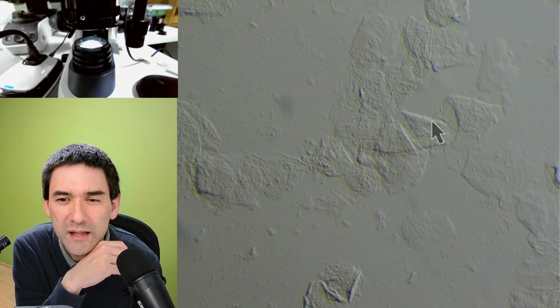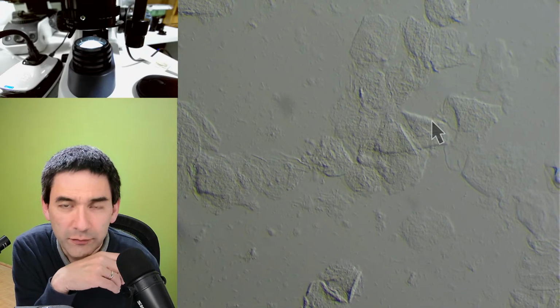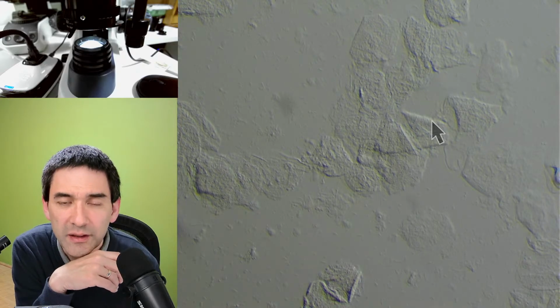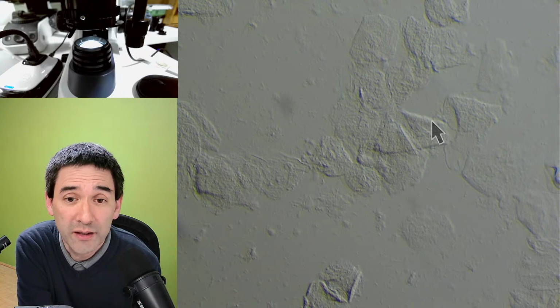So what is a screw mount? I don't know. And is this suitable for long-term storage and repeat? I don't know. I'll have to research this, okay? But thank you, Marcel, for asking what a screw mount is. Maybe someone of you knows that.